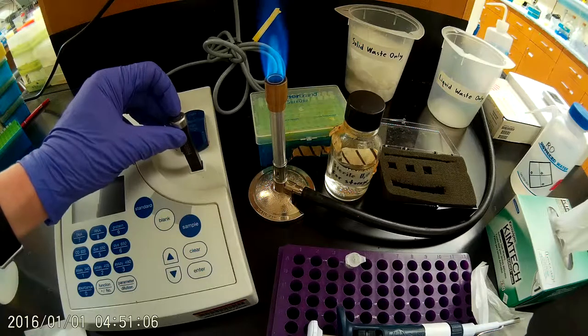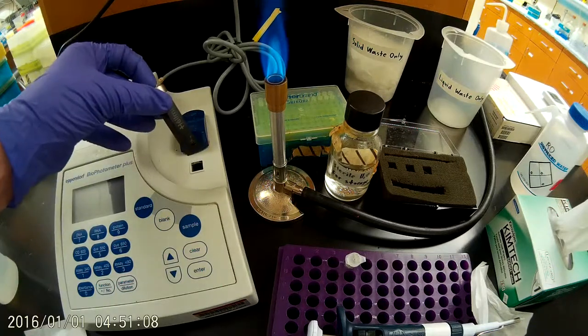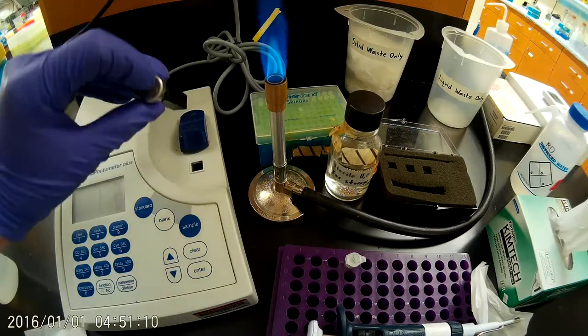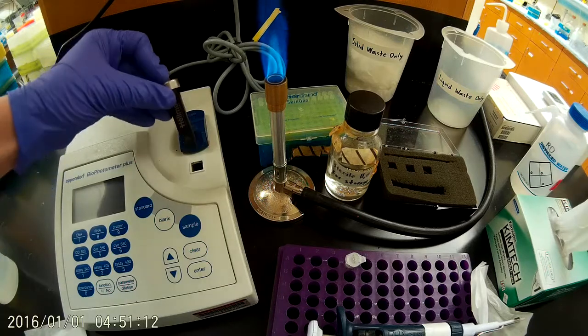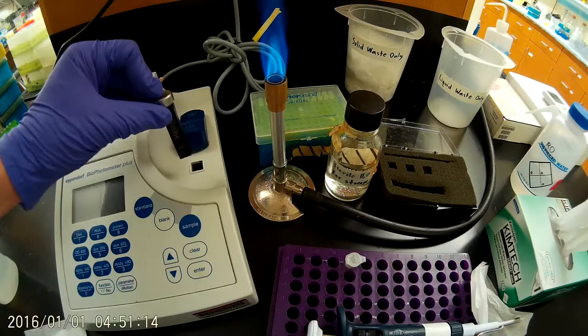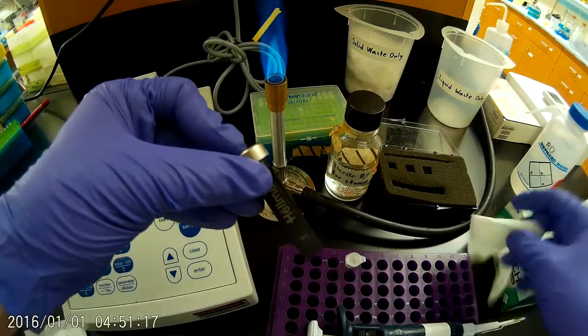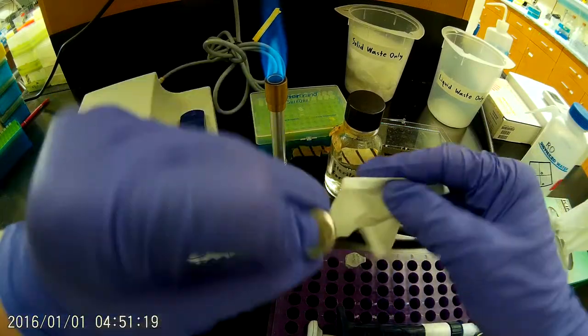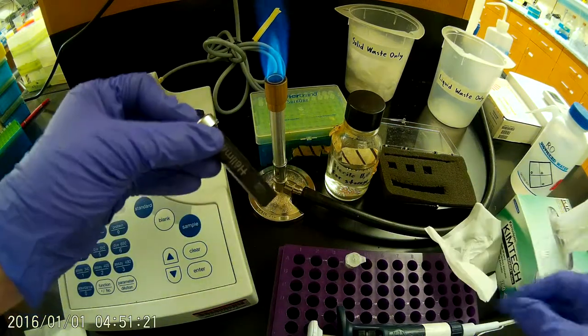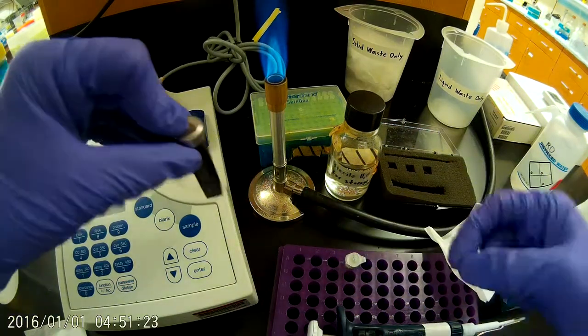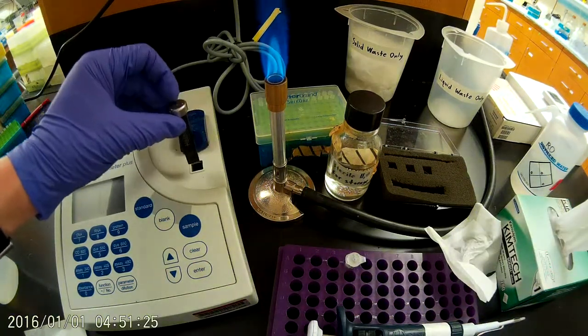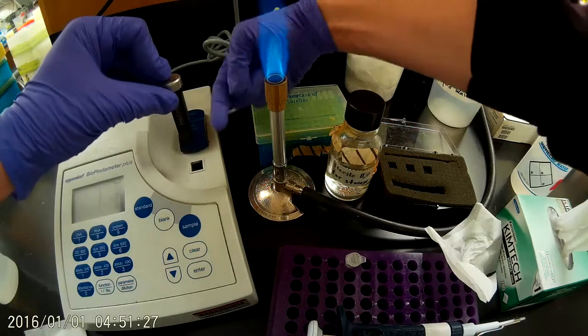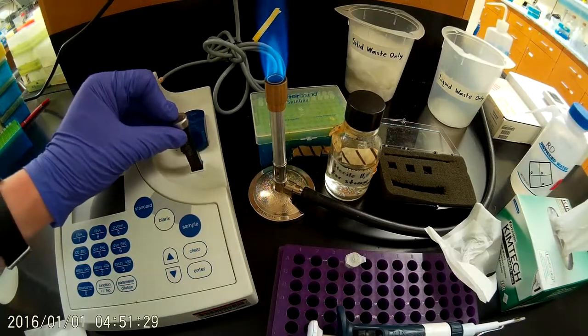Okay, so then I'm going to insert that into the biophotometer. You want to be consistent in the direction that you put in the cuvette. So I try to just put the text facing towards me all the time. You can see that mirror there. Actually, we should clean that off as well. Make sure that there's no grease or dust on there. That glass window there, that's what the light's going to pass through. As long as it's oriented this way, you're going to be fine. Just try to be consistent.